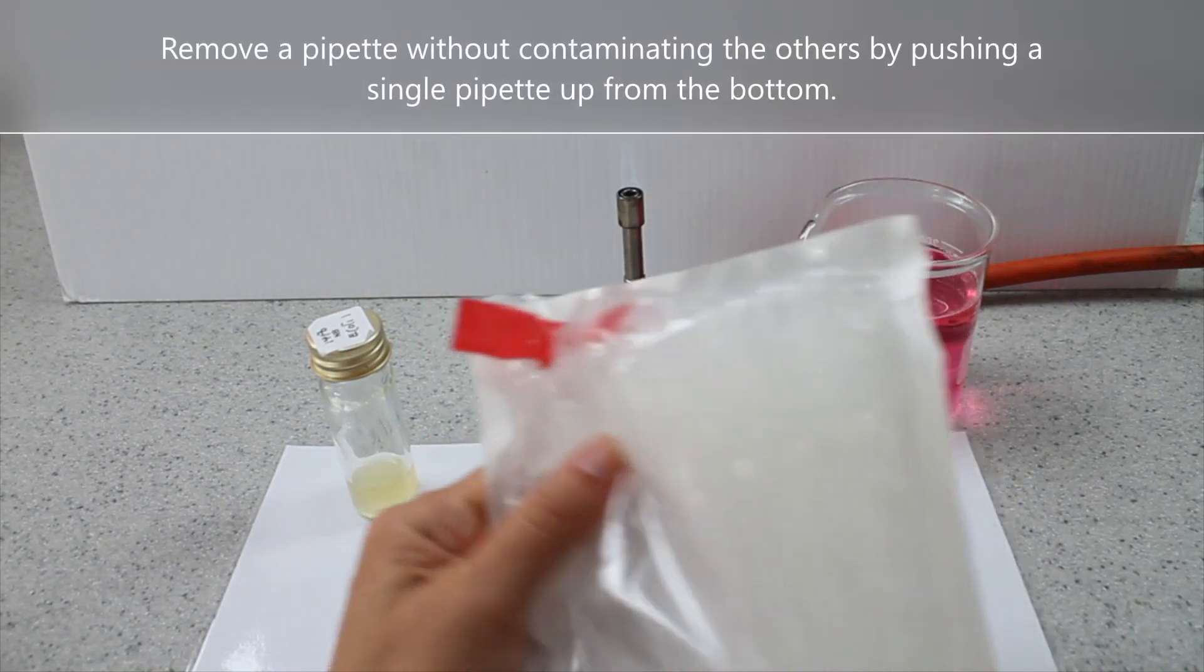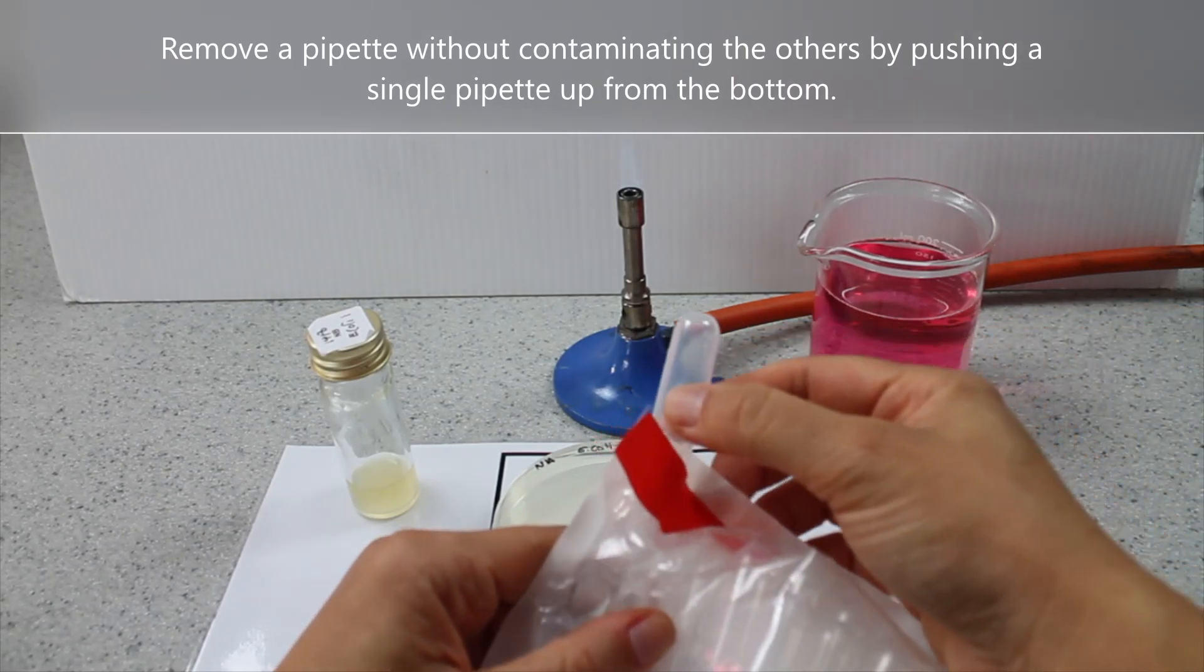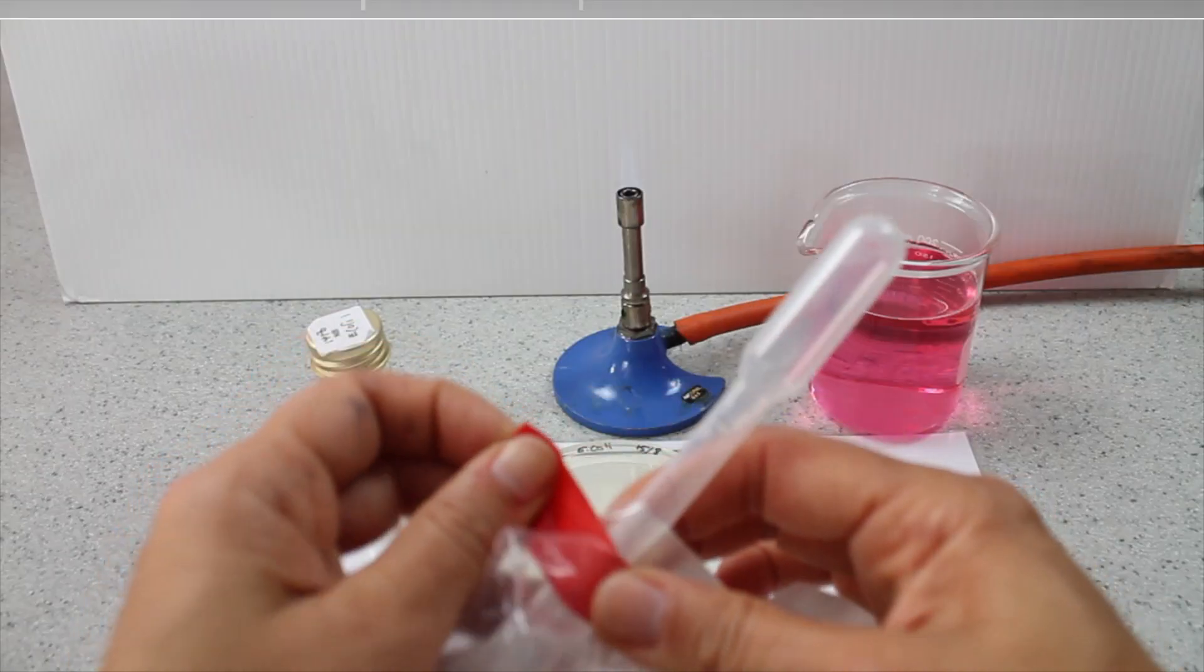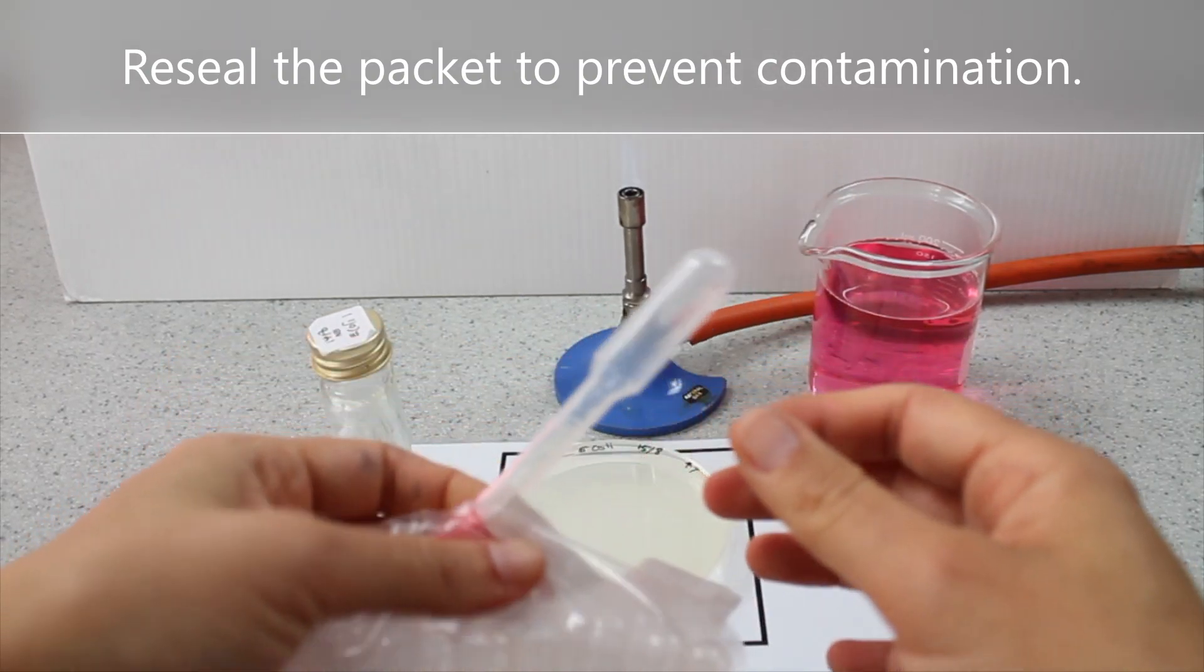Remove a pipette without contaminating the others by pushing a single pipette up from the bottom. Re-seal the packet to prevent contamination.